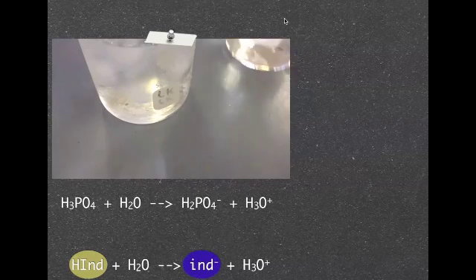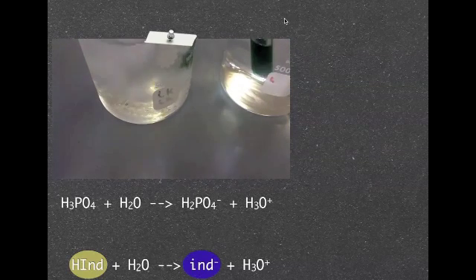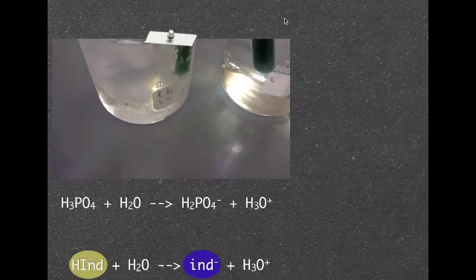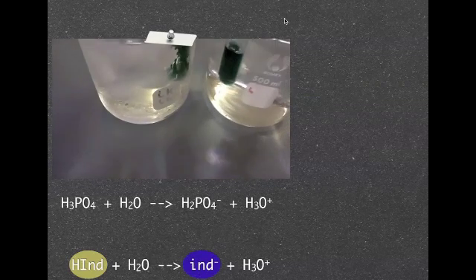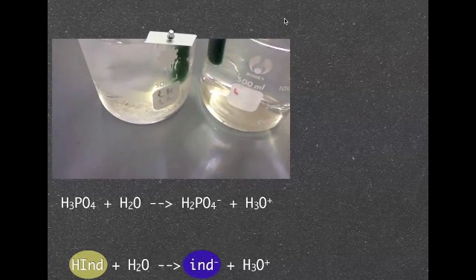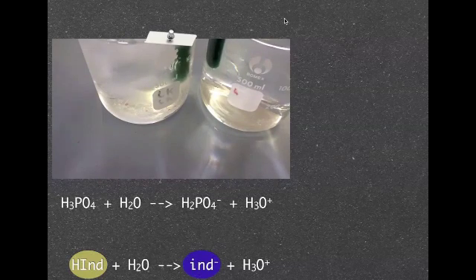I've got a beaker there of ice water and I've got another beaker there of hot water and I've put them in there just to try and change the temperature a little bit and I'm just going to let that play and let you see what happens to the temperature, to the color as the temperature changes.